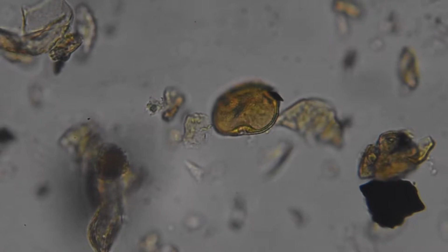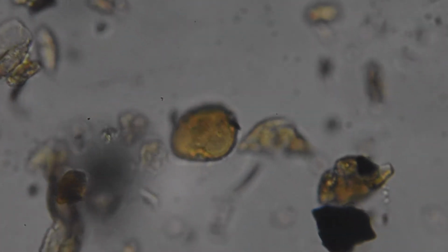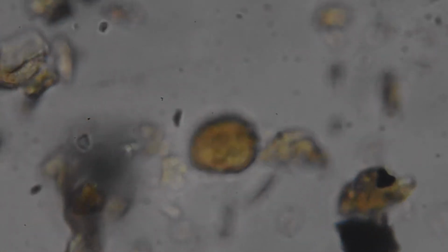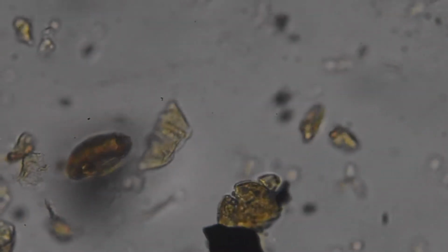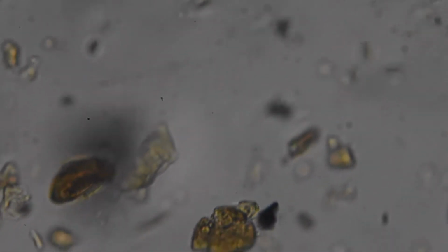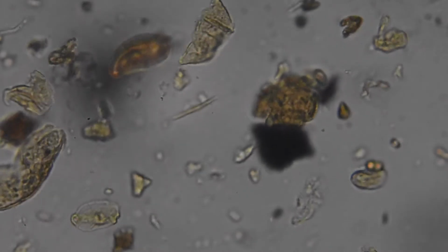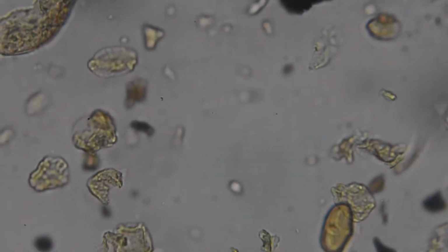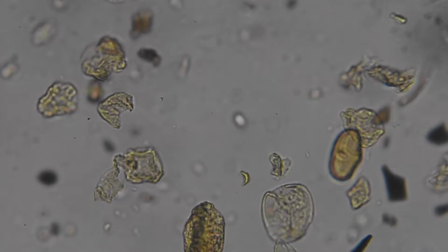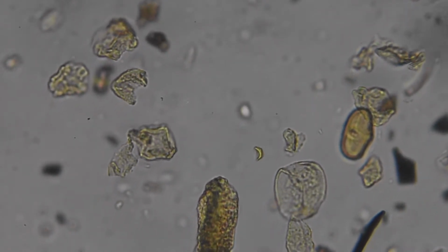And I can make things move around on here as well. So they're in a kind of gel, which means that I can move them like this. Oops, and send it all flying. But also you hopefully get the idea that these things are not necessarily flat. So a pollen grain, normally when you would find it, is quite round. A bit like a ball is probably the easiest way to describe it.